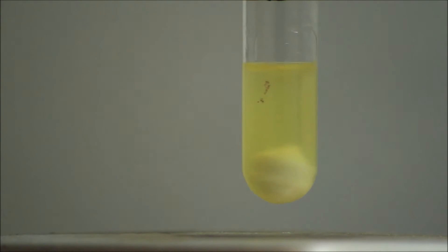Then the potassium hydroxide solution is carefully added. Finally, 0.1 milliliters of pure acetone are added to the reaction vessel.